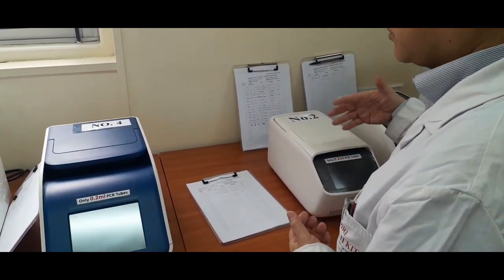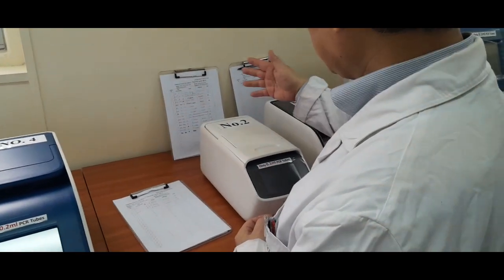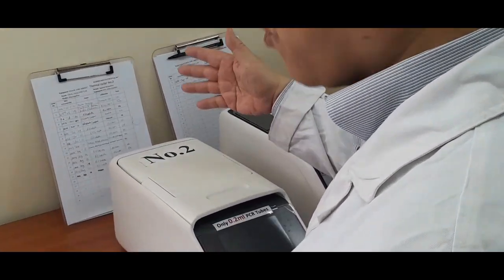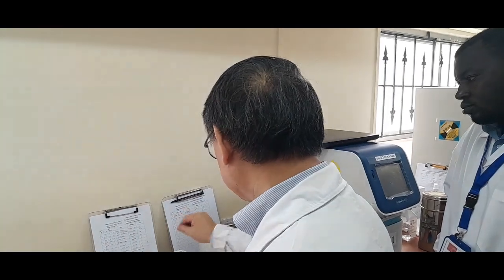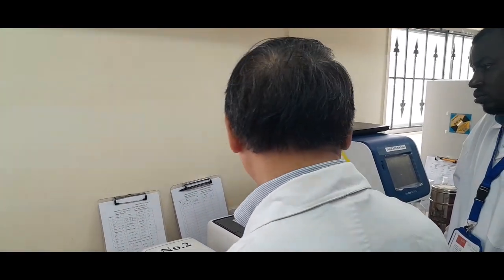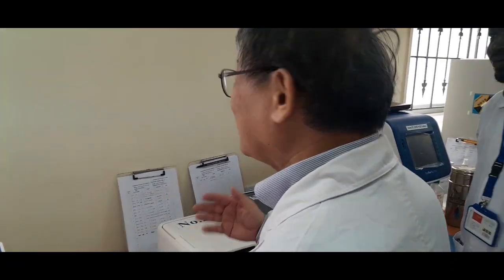how often the machines are used, and any trouble or challenges encountered, they can write, so that we can fix it quickly. Not to find who broke it, but to quickly troubleshoot. Troubleshoot, yes. We never charge the user to fix it.